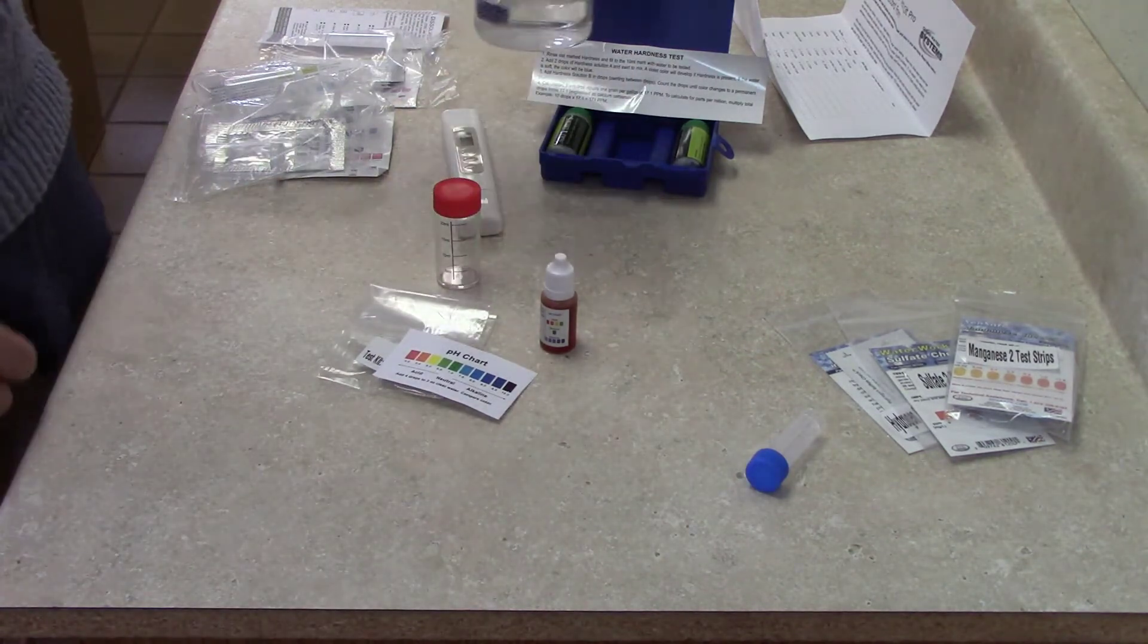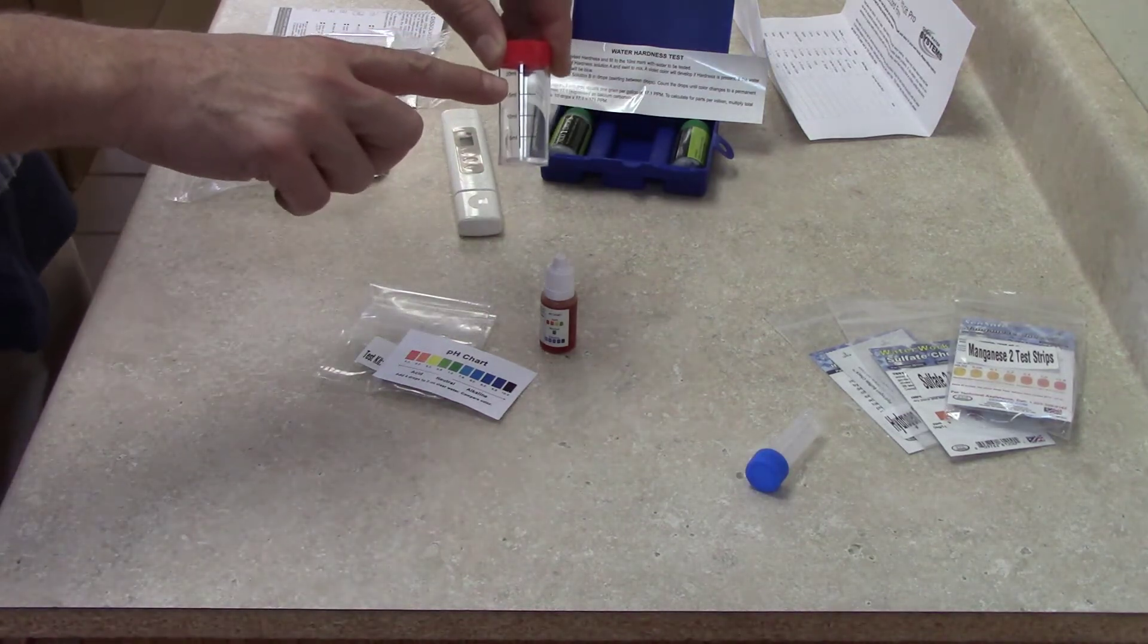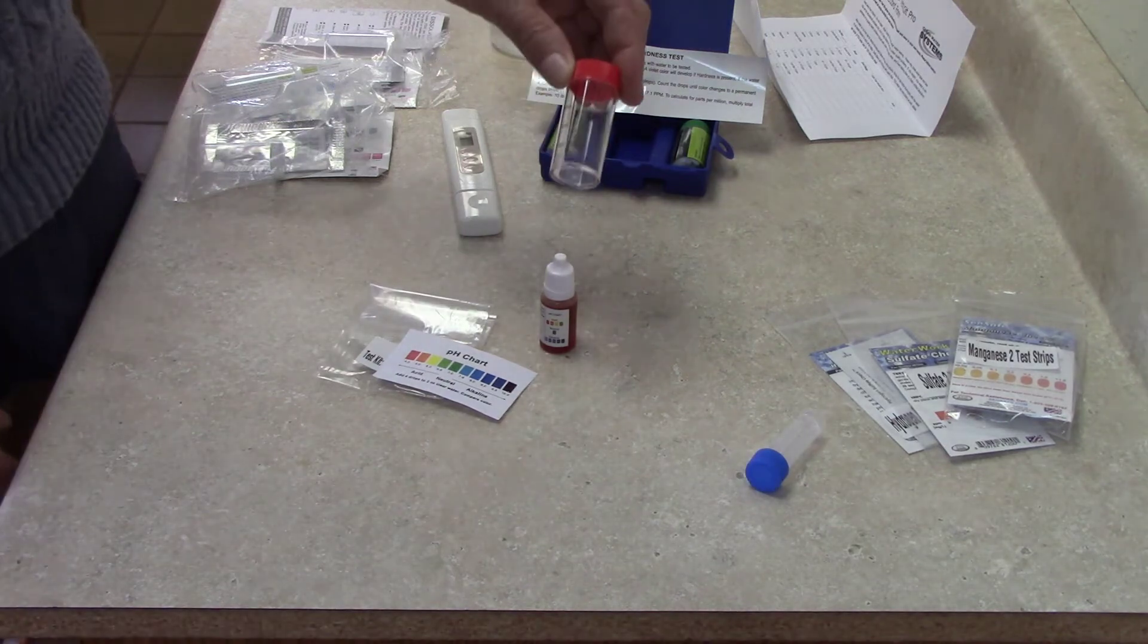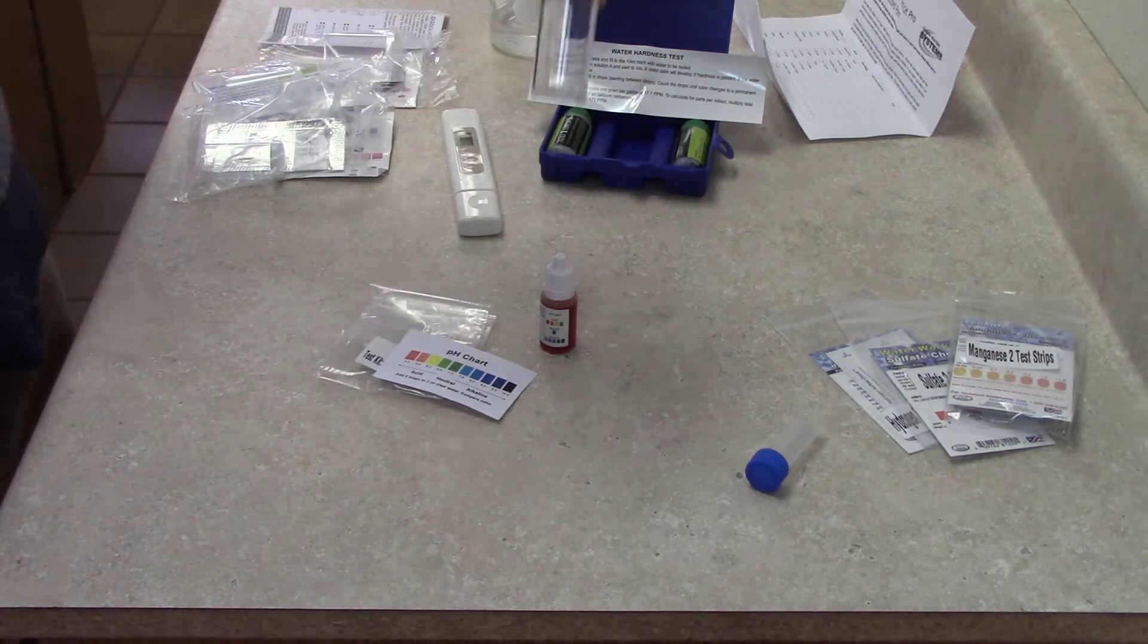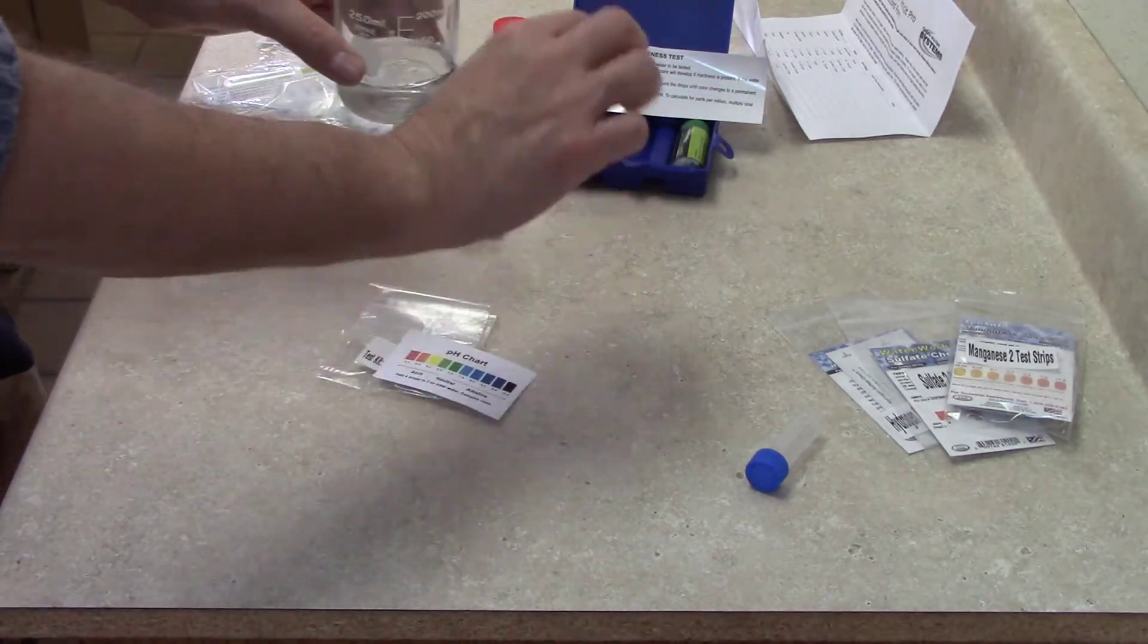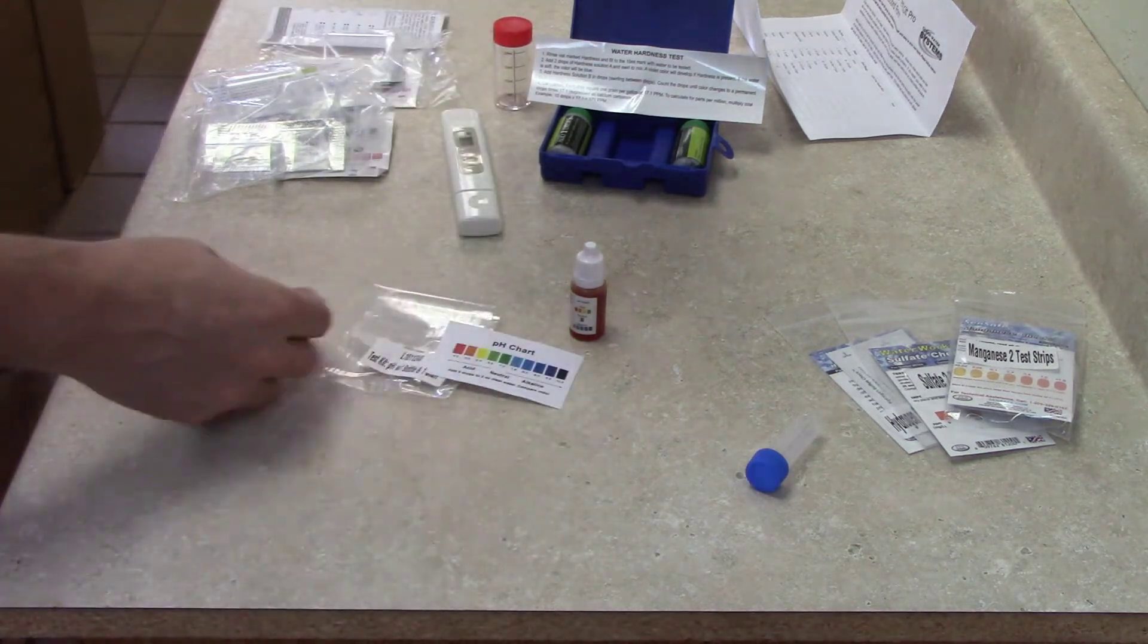If you really wanted to measure accurately, you could measure three of these - 20 milliliters each, so 58 or 60 milliliters is a quarter cup. That would be a way of doing that. Once you get a quarter cup, you add your four drops, then compare it to the color chart. For the pH test, the idea is you're providing your own container.